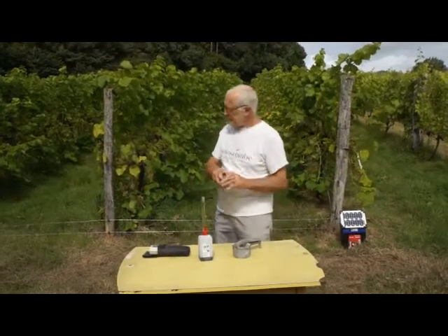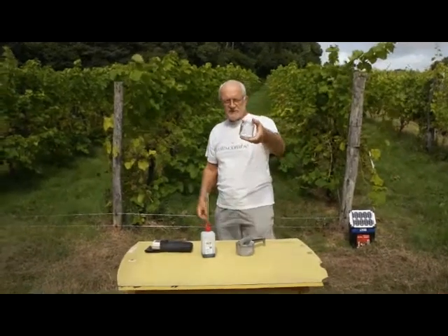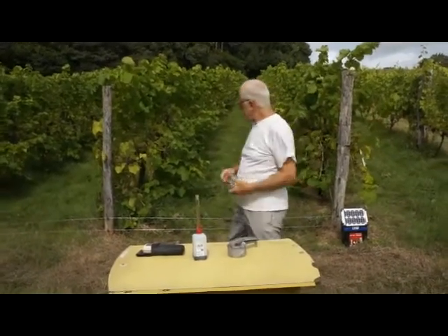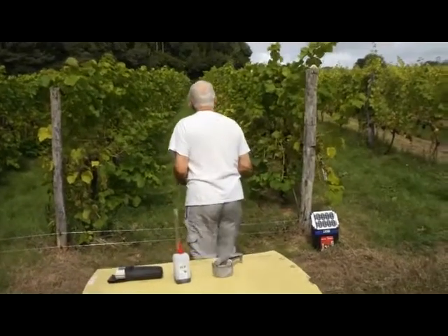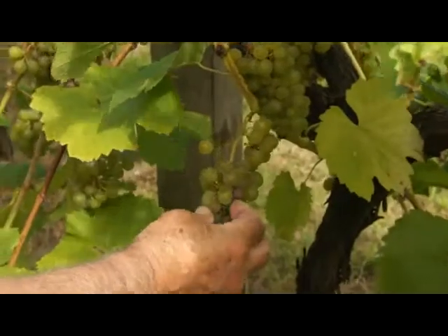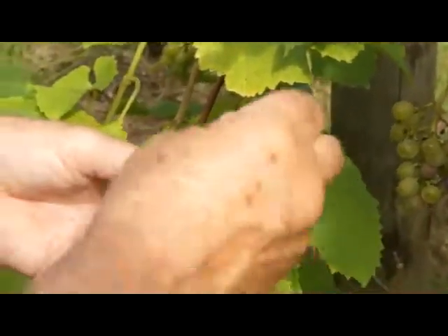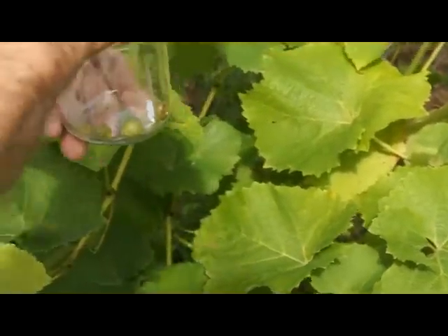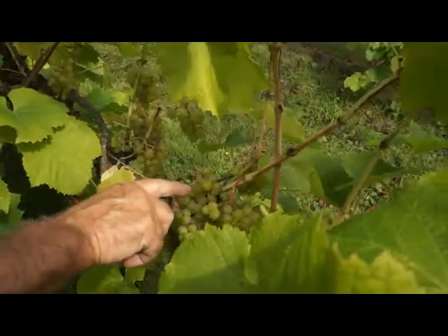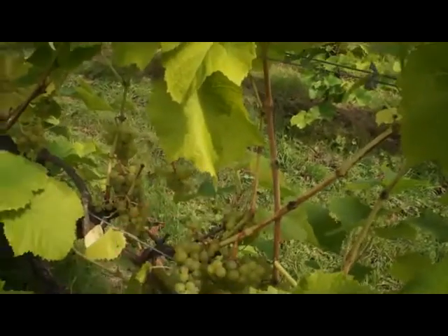We take this jar and we're going to try and get a representative half a jar of grapes. There's a trace of botrytis starting there, so I'll just take part bunches — I've got like four grapes there. Put them in, and then I'm heading diagonally. We're heading up this way. And a few big ones — take a sample of those, pop them in.